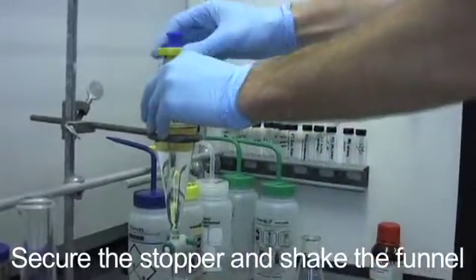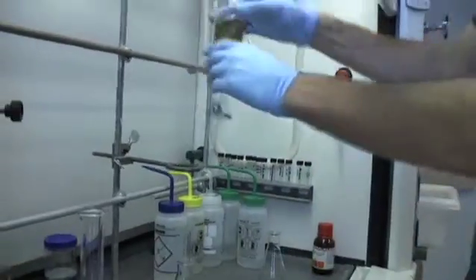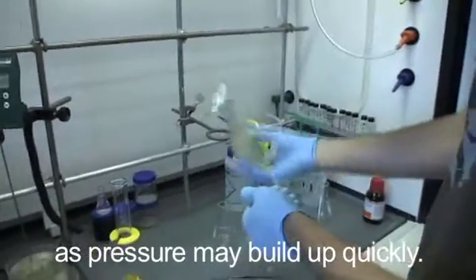Secure the stopper and shake the funnel, being sure to hold the stopper so it doesn't fall out. Vent early and often by opening the stopcock, as pressure may build up quickly.